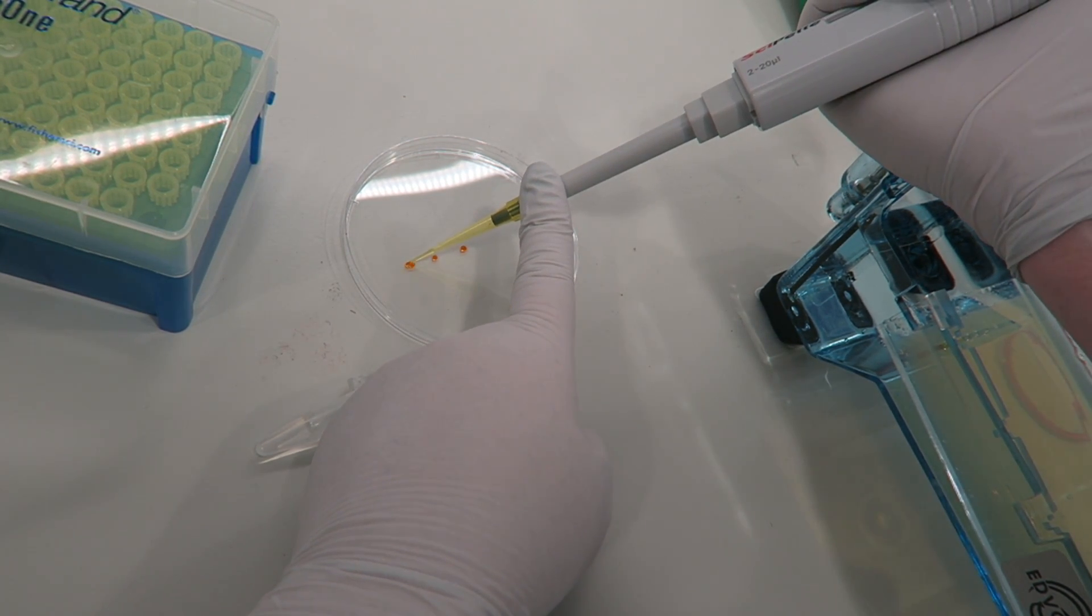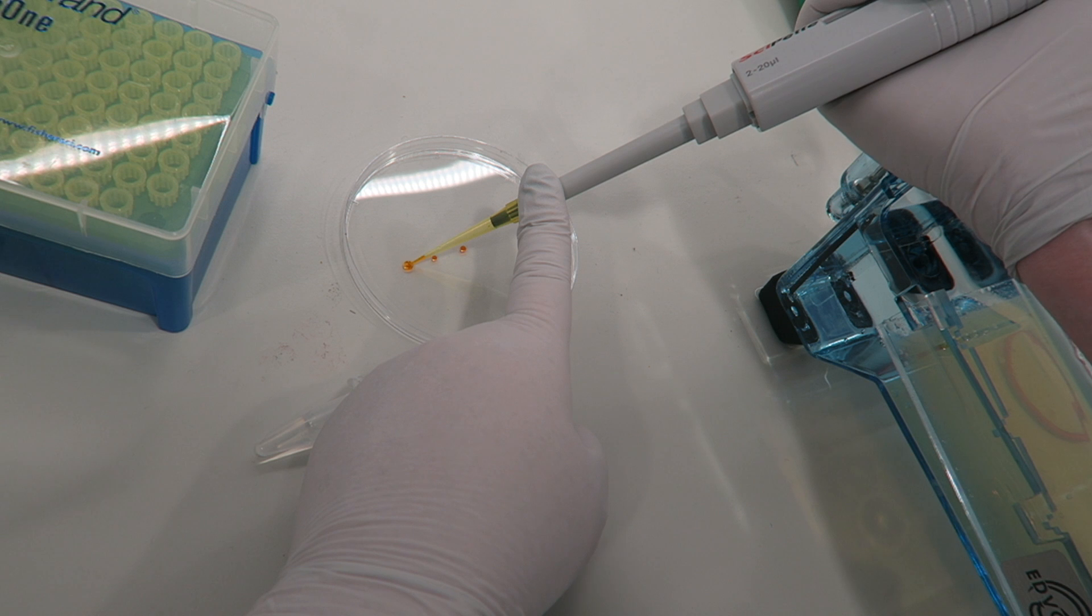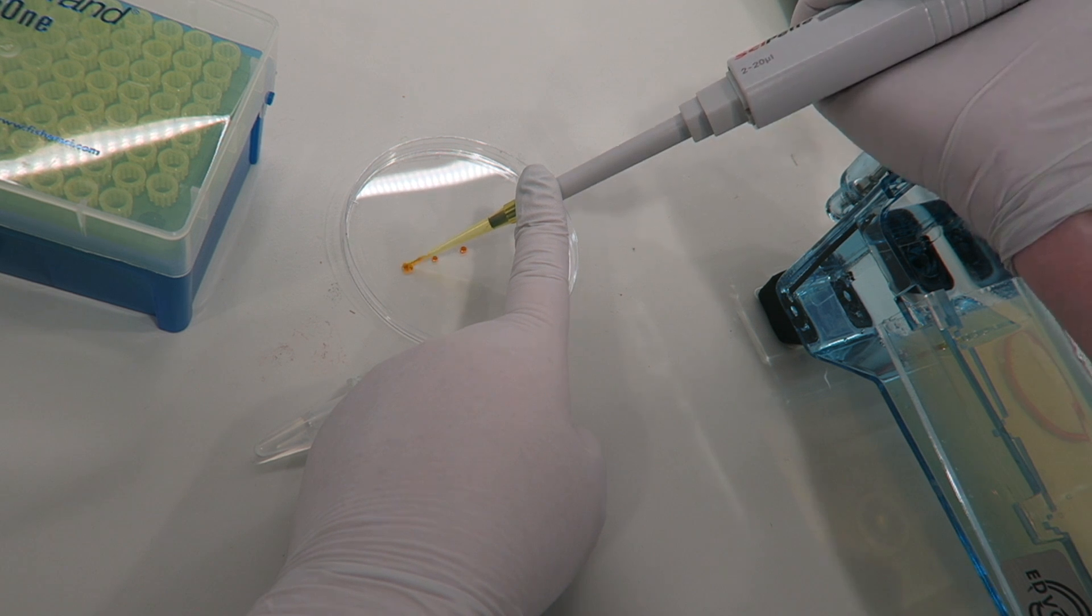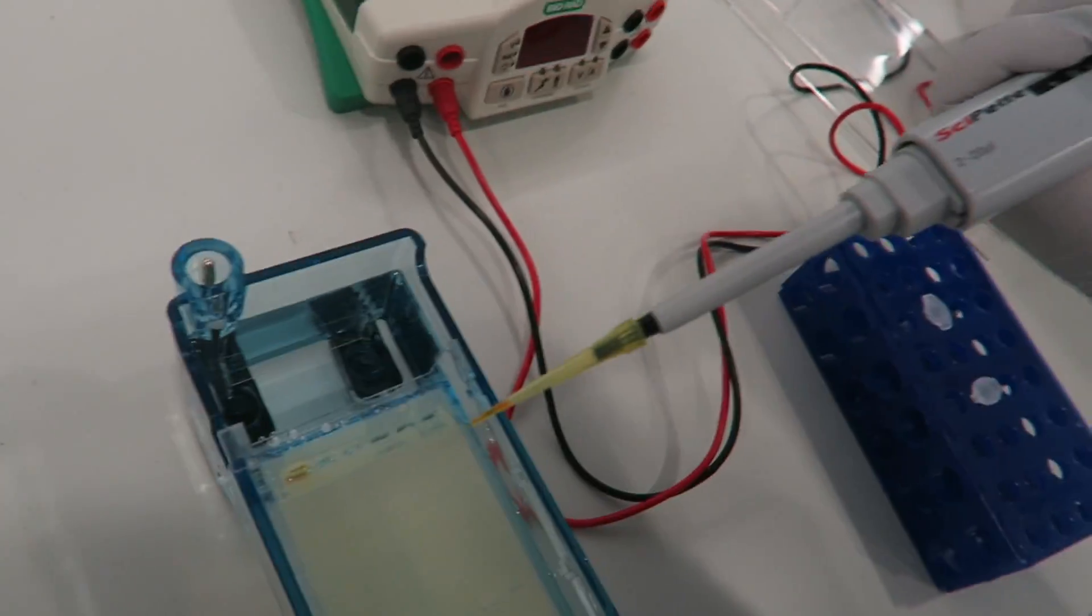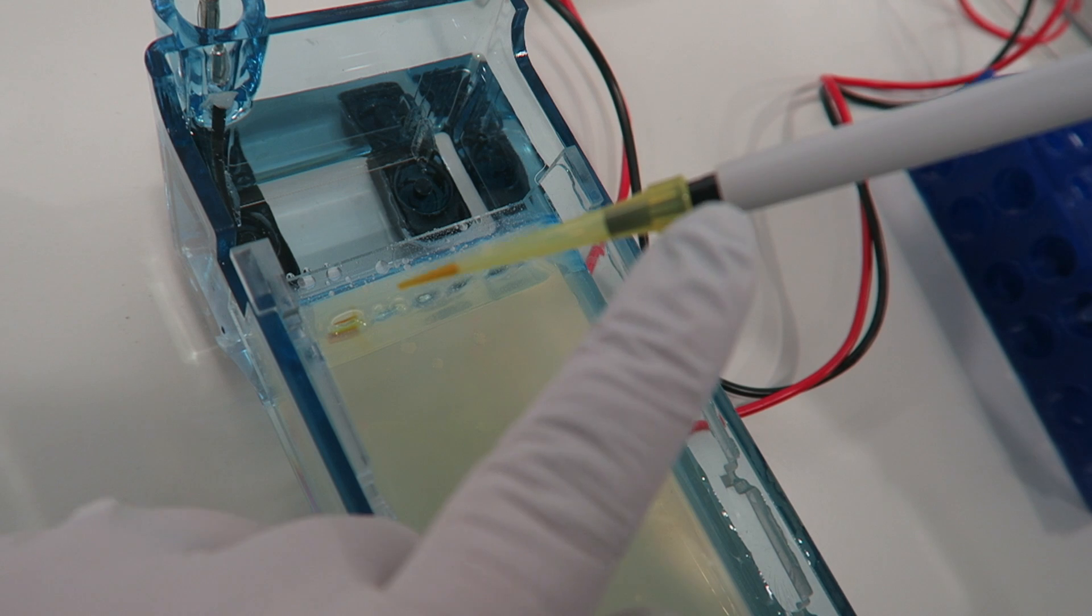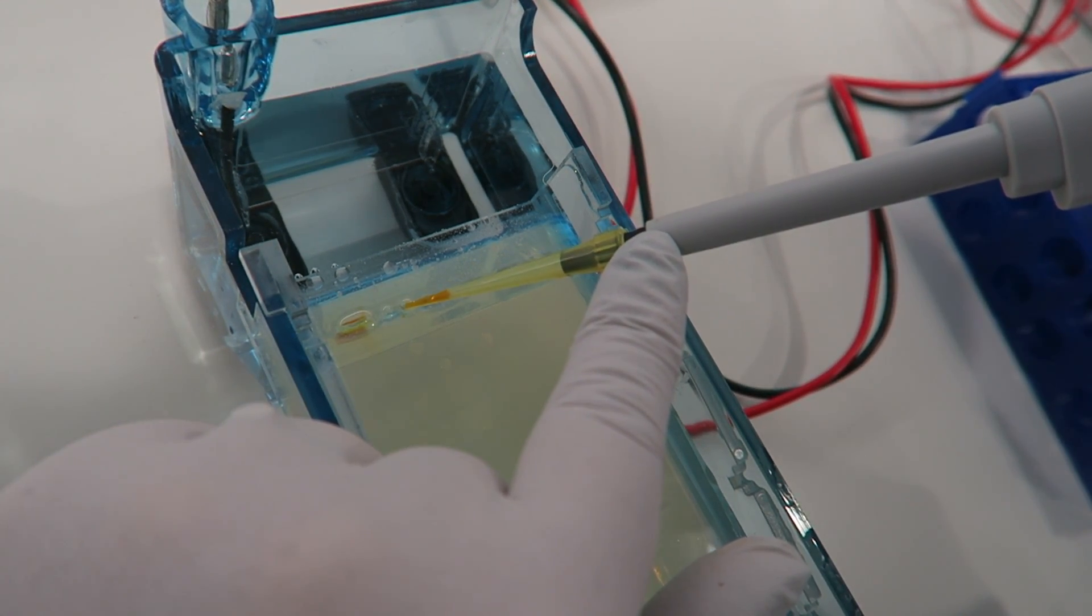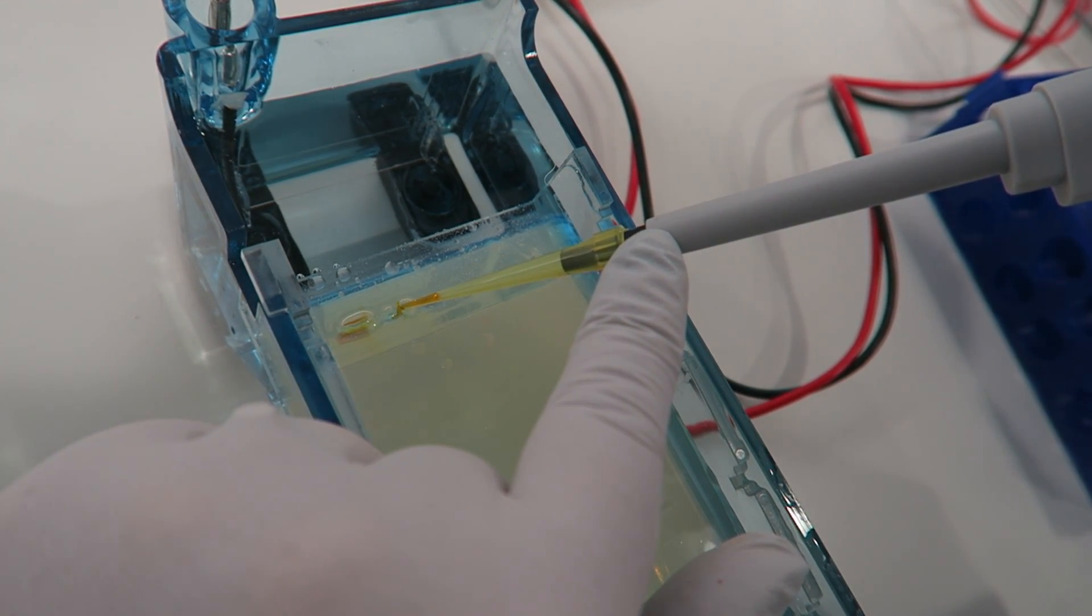You can mix it with the sample in a number of different ways. I'm choosing here to mix it on the lid. Here is our sample going in. In the first well a ladder is added so we can see the size of things.